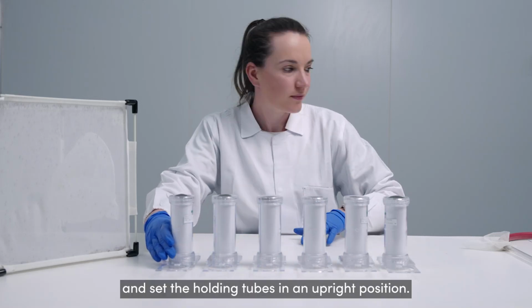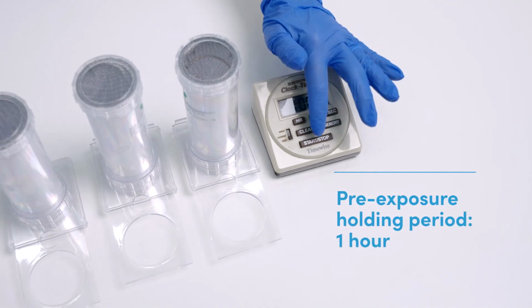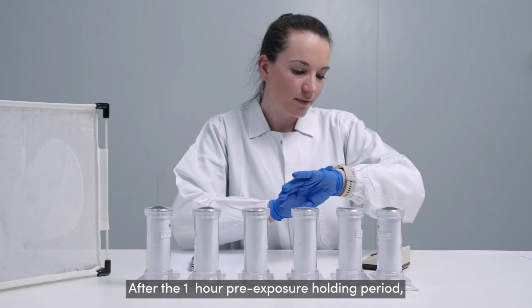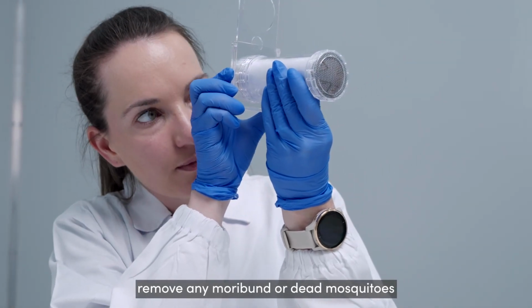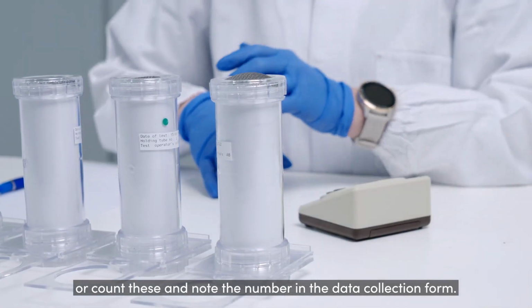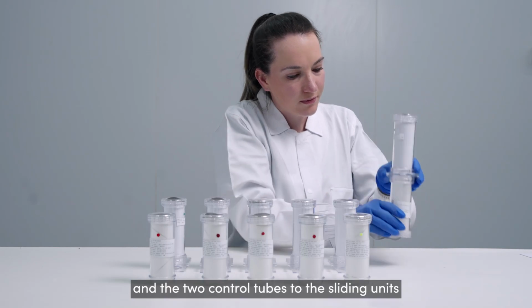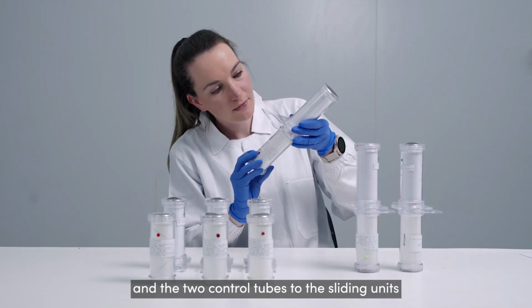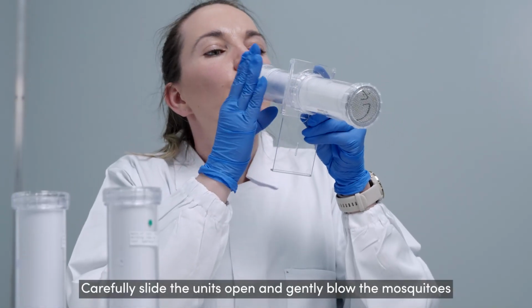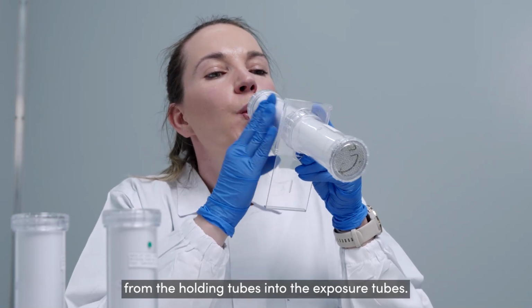Close the slide unit and set the holding tubes in an upright position. Leave the mosquitoes in the holding tubes for 1 hour. After the 1 hour pre-exposure holding period, remove any moribund or dead mosquitoes, or count these and note the number in the data collection form. Next, attach the 4 empty exposure tubes and the 2 control tubes to the sliding units on the respective holding tubes. Carefully slide the units open and gently blow the mosquitoes from the holding tubes into the exposure tubes.